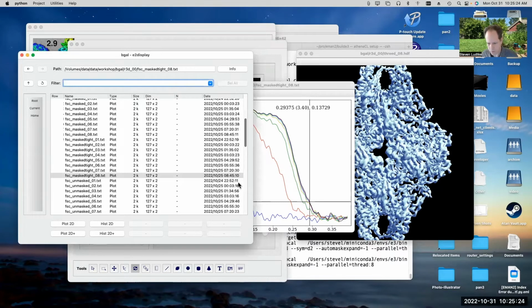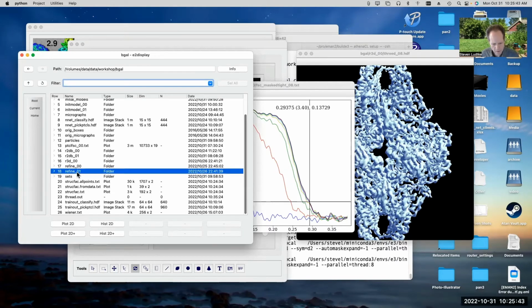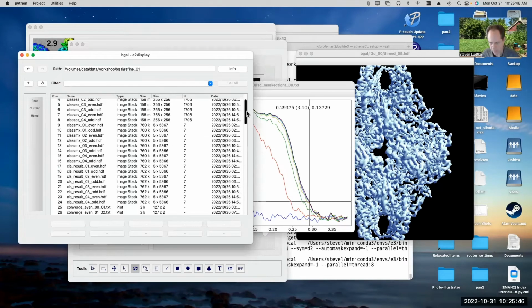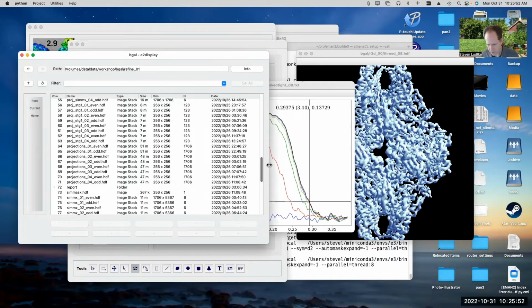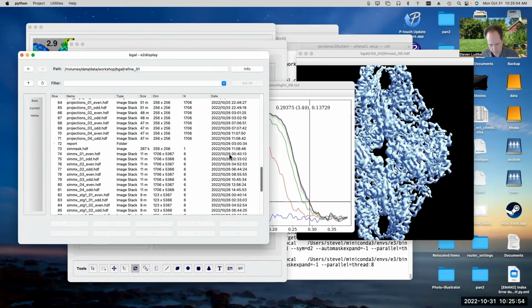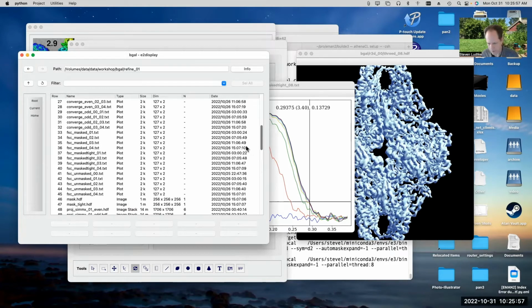So how long did it take to run? You can see this finished at about, the last iteration came out at 8:45. The first iteration came out at about 10 p.m. the previous night. So here you see about an hour and a half per iteration, something like that. If we go and look at the second refinement I ran with the speed 1 option, so the slower refinement there, you can see the FSC, that's easier to see. Each of these iterations took longer, took 4 hours to run.